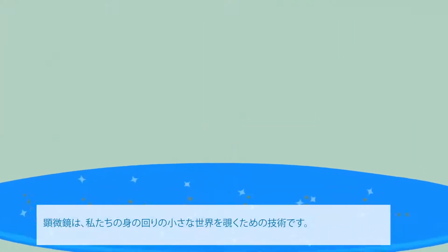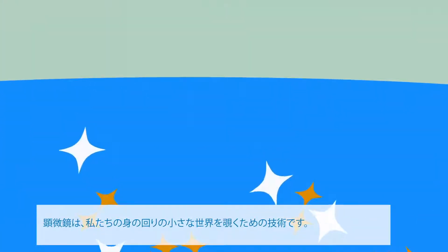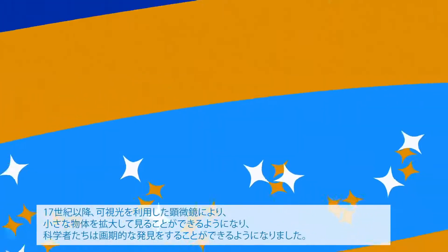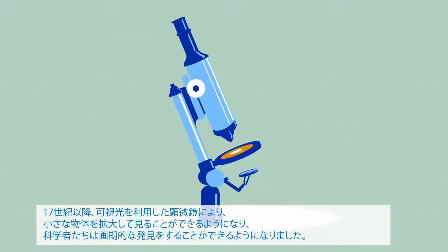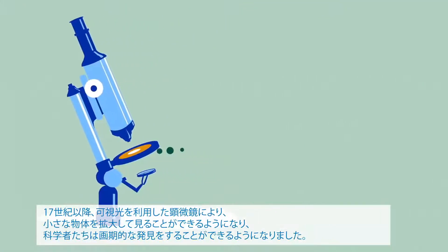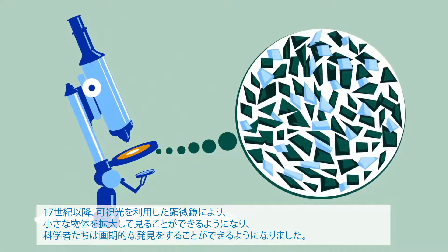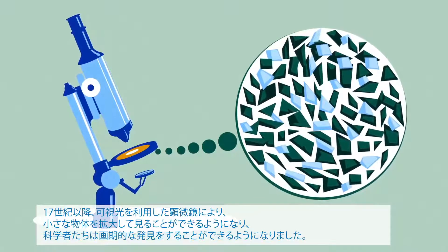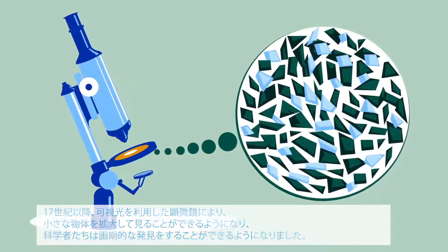Microscopy is a quintessential technique used to understand the microcosm around us. Since the 17th century, microscopes have used visible light to provide a magnified view of miniature objects, enabling scientists to make breakthrough discoveries.